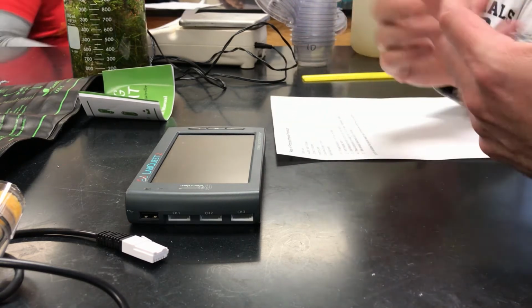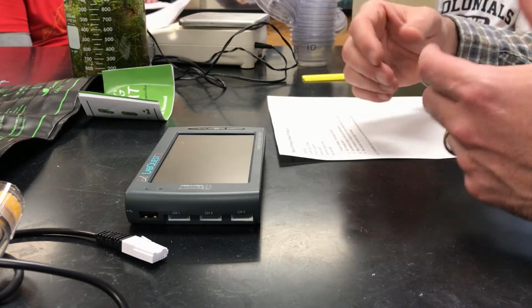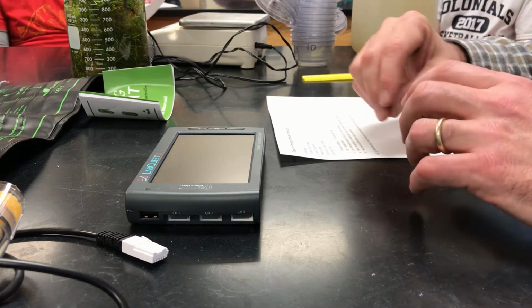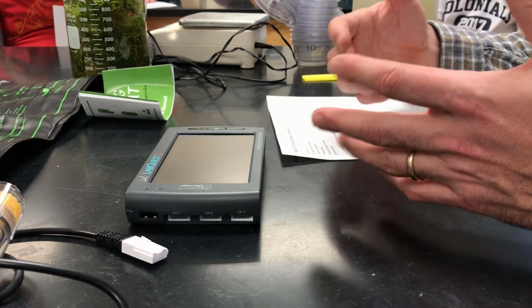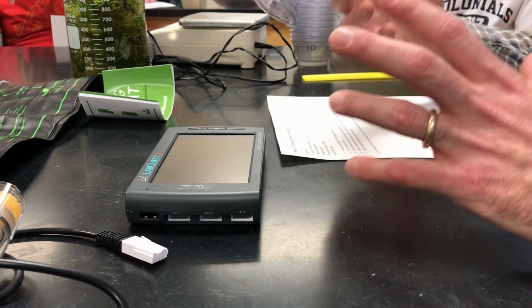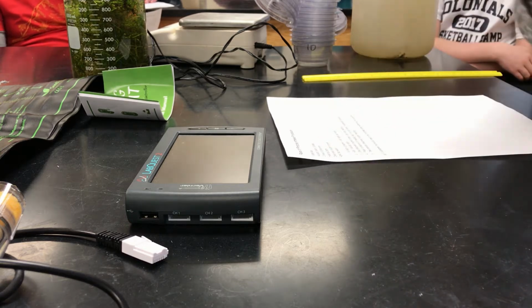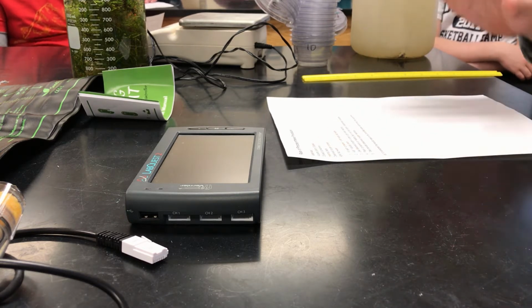But I'm going to walk you through the rate of photosynthesis procedure for the term 2 lab. So just a couple things before we get into it. The goal of the term 2 lab is for you to get an experience of trying to execute a fairly easy, fairly simple lab experiment and generate your own data that you can do some intro analysis of. That is the goal. It is not supposed to be to find 10 crazy variables or all kinds of crazy things.